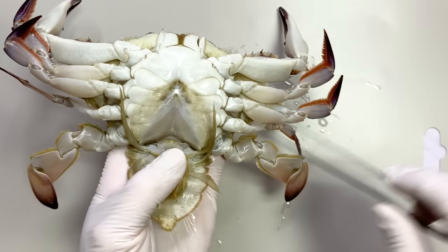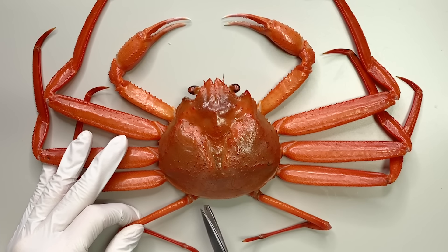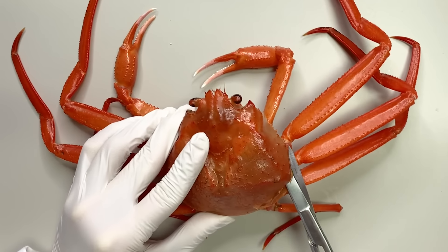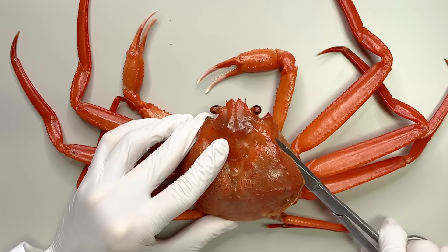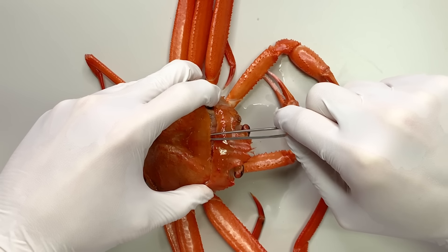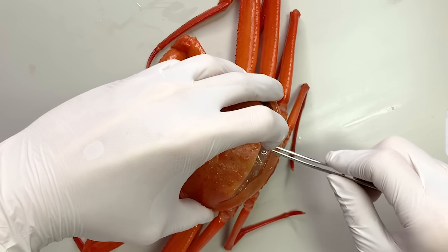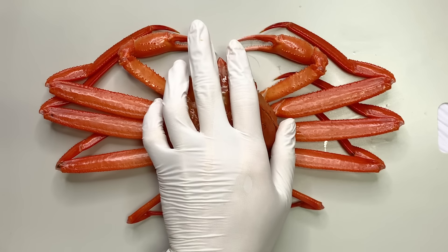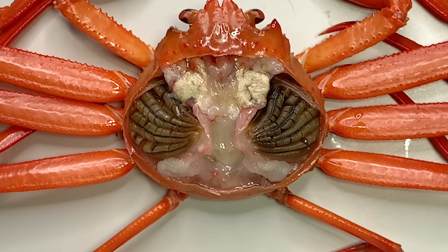Fascinating, isn't it? Now, let's dissect the crab. Make a small incision on the carapace, carefully cutting and separating the inner membrane. These are the internal organs of the crab.